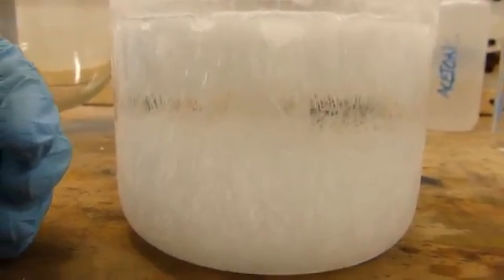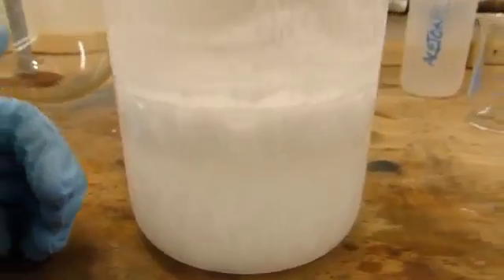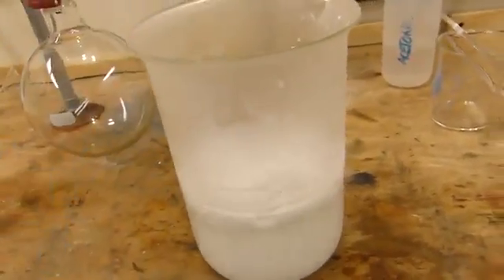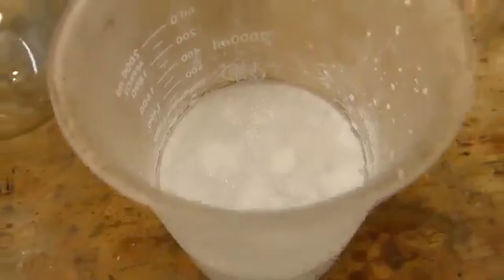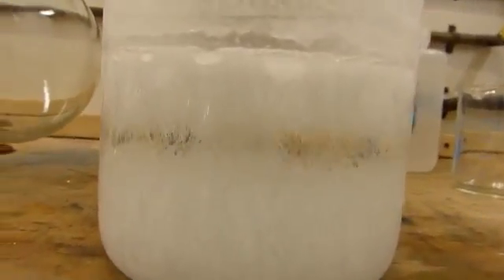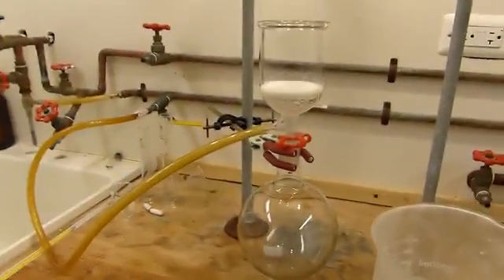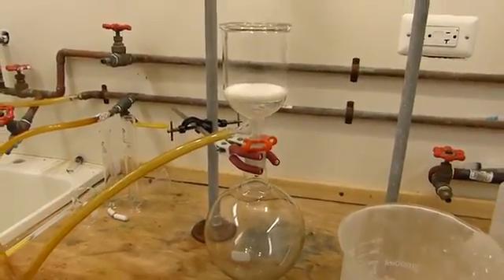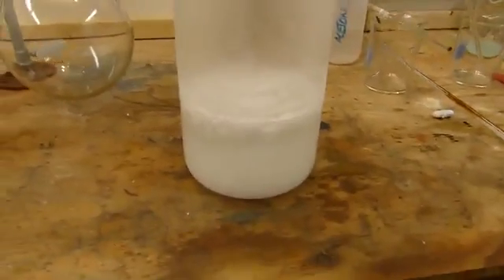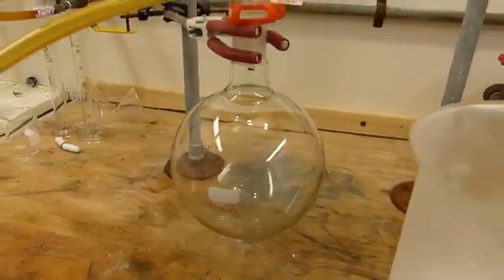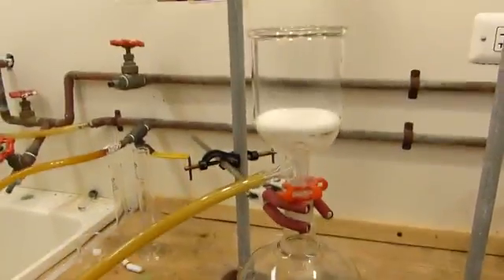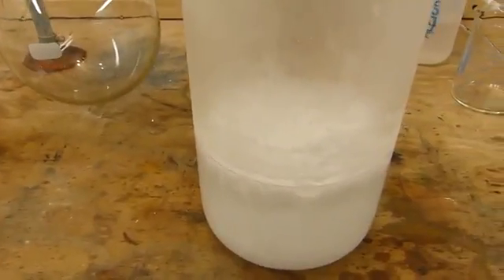All right, I just removed the benzoic acid solution from the freezer. You can see it's a little frosty on top. And looks like we've crystallized a lot of the benzoic acid. That looks really cool. You can see in there some sort of forest of crystals. And I've once again set it up for vacuum filtration and go ahead and run this through. Since I have over a liter of material here, I'm probably going to have to fill up this flask and empty it out a few times, but no big deal. Let's get to it.